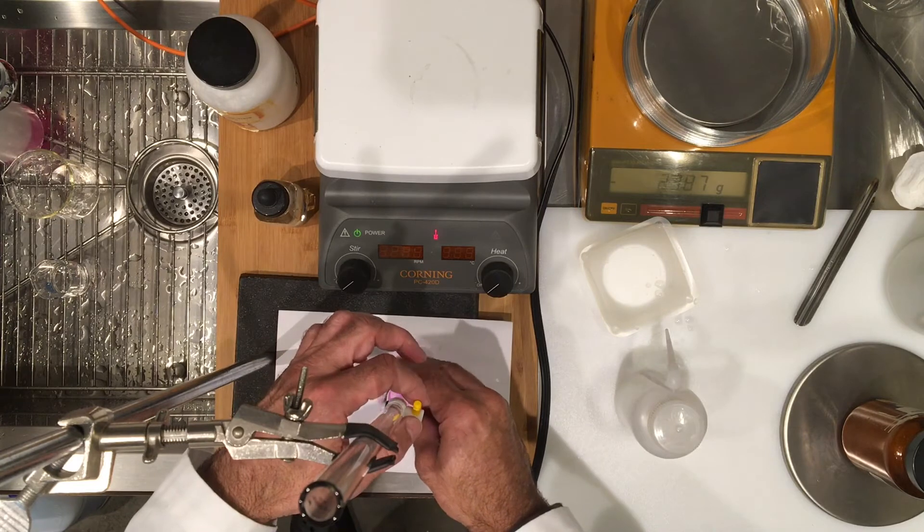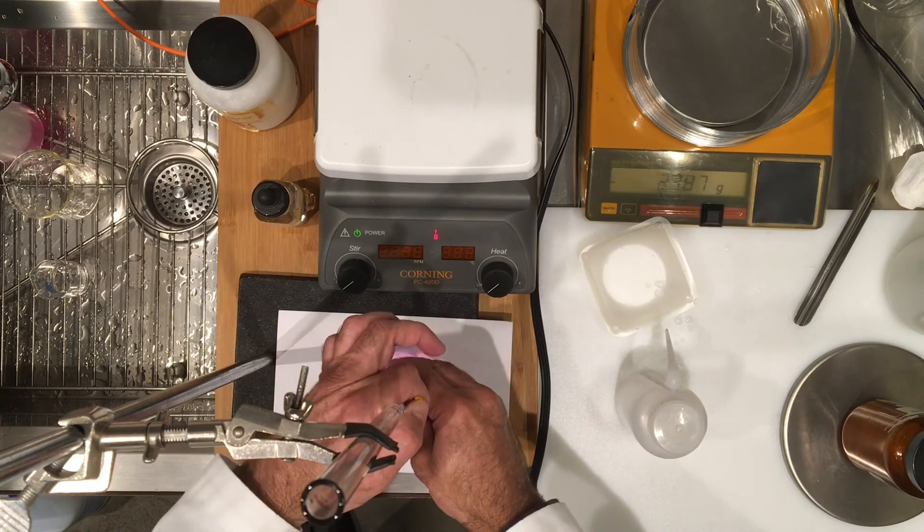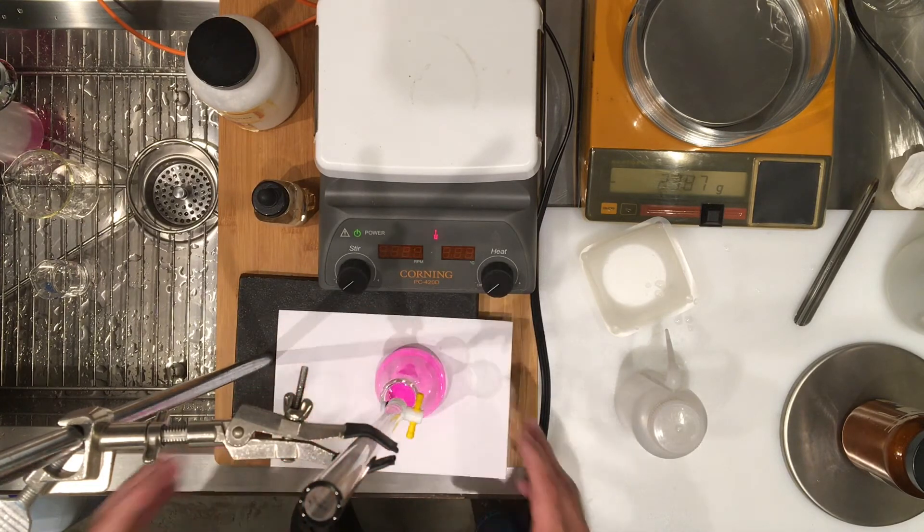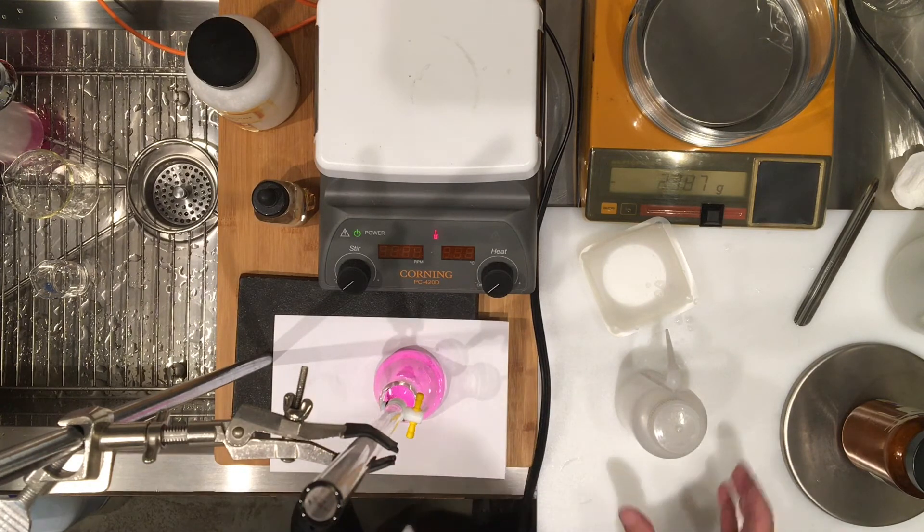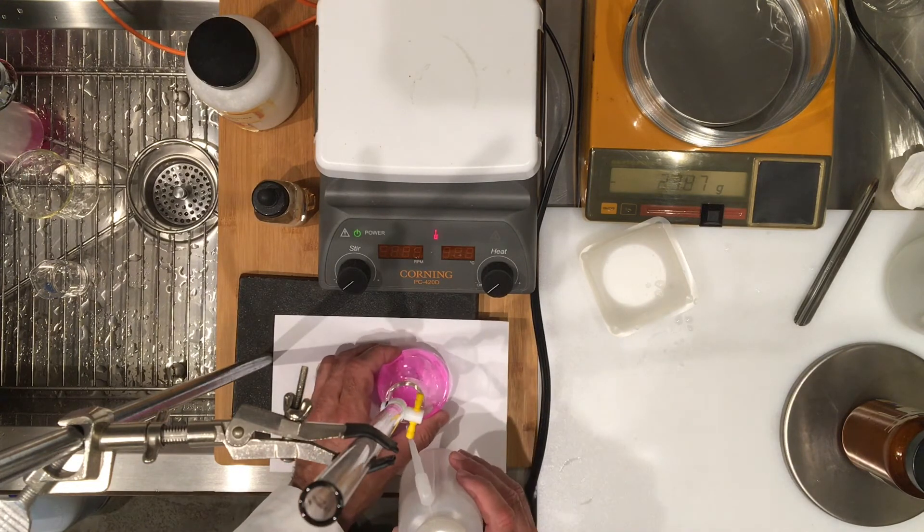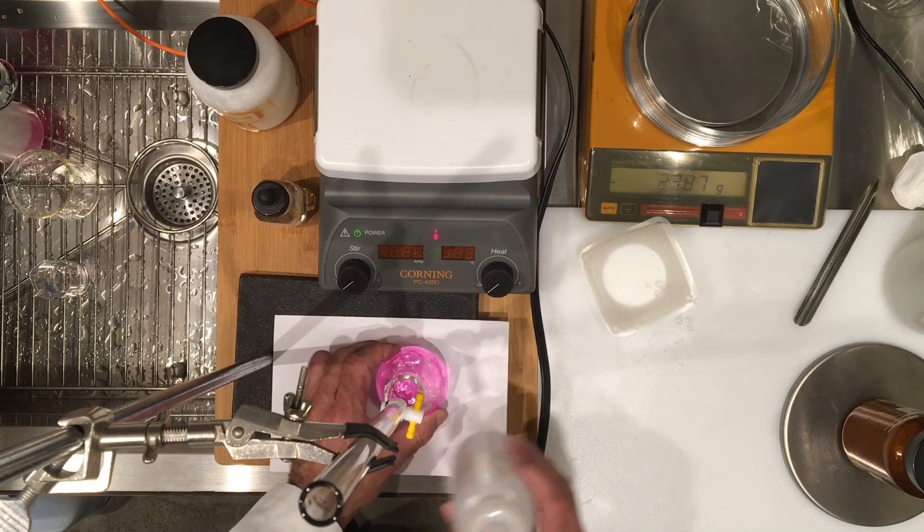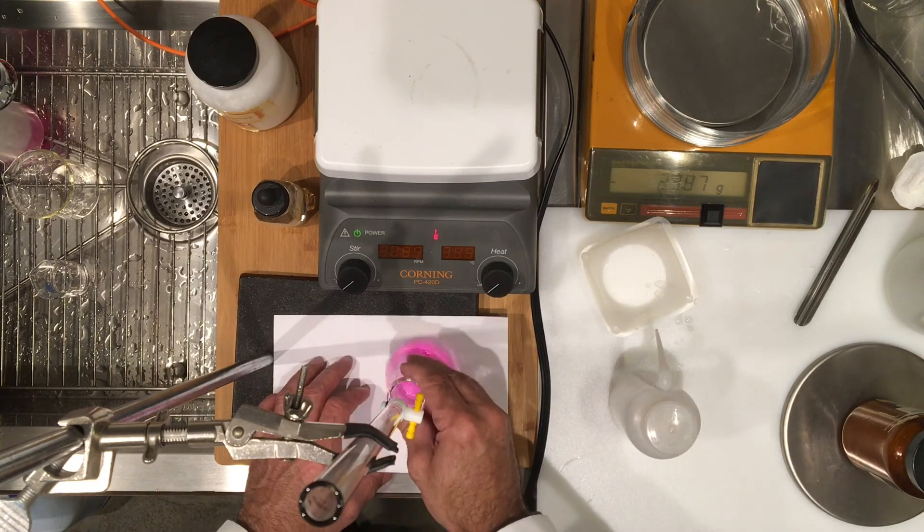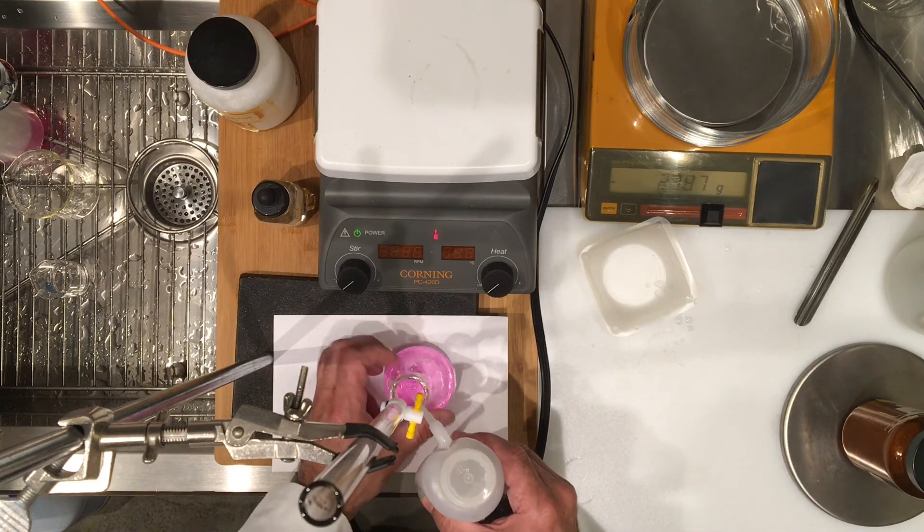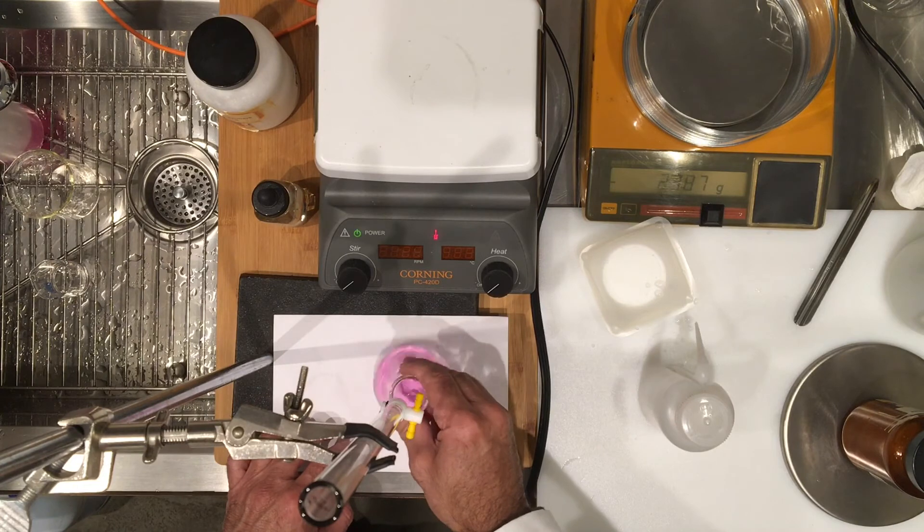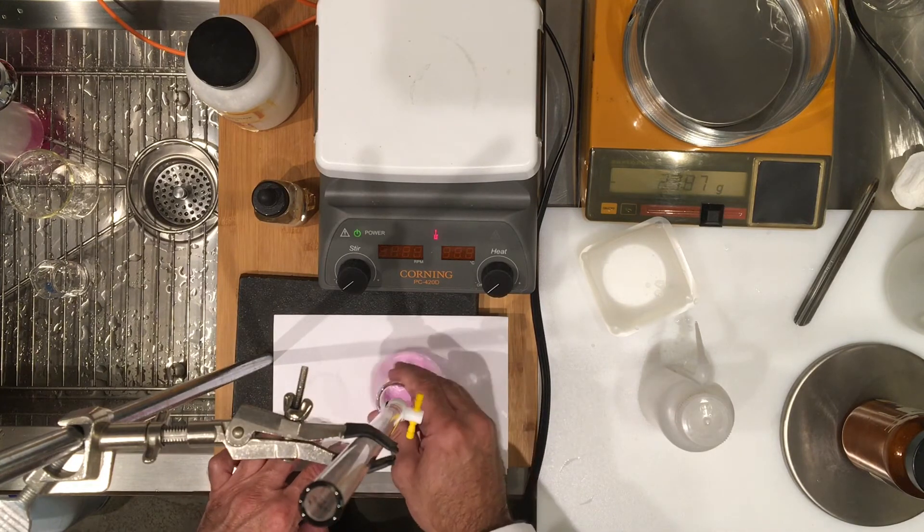There it is, it's still slightly pink. There may be half a drop here, but I'm going to just wash it in. This is still a good endpoint. I can see that the color stays. Sometimes the color goes away, and the color is staying, so it's pretty good.